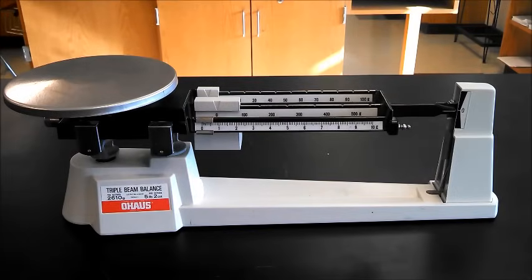Hi, this is Mr. Beiter and this is a quick tutorial on how to use a triple beam balance.